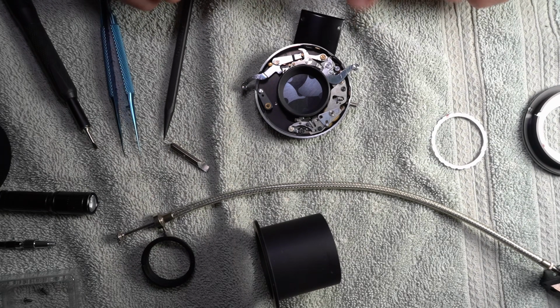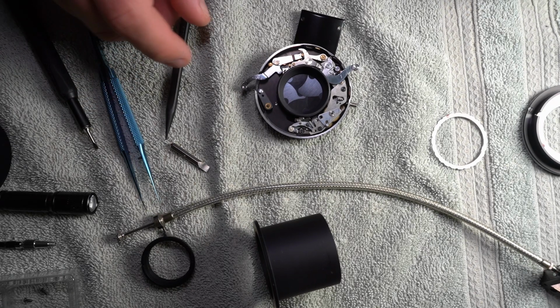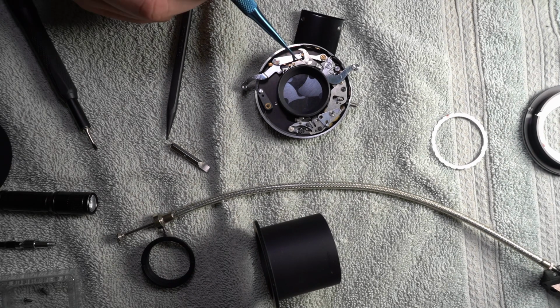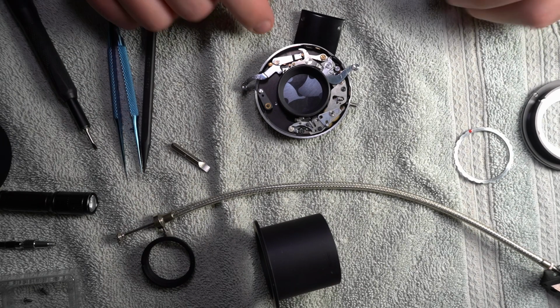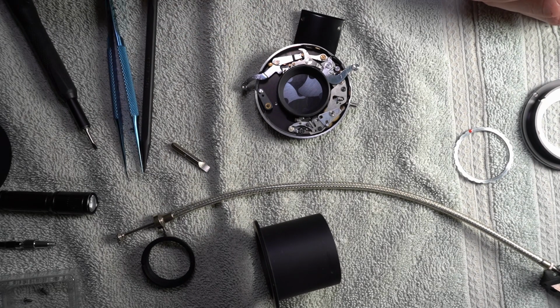This has strong enough springs in it. I don't think that getting white lithium grease on it right now would hurt it. But as that dries out, because everything dries out, even the really nice synthetic stuff is going to die eventually. When that dries out, it gets a couple specks of dirt, some worn off filings from the movement, because it's metal on metal. It's going to do that. That's the whole reason you use grease, because you don't want it to do that for as long as possible. Anyway, the whole idea is you don't want too much grease. I don't think I put too much grease on it, but I was extremely careful not to.